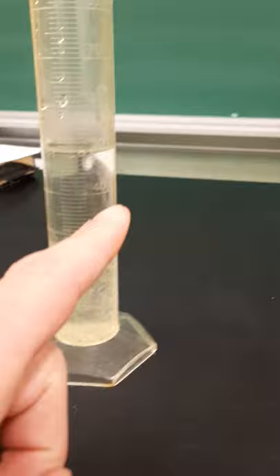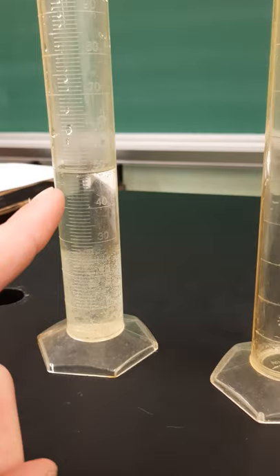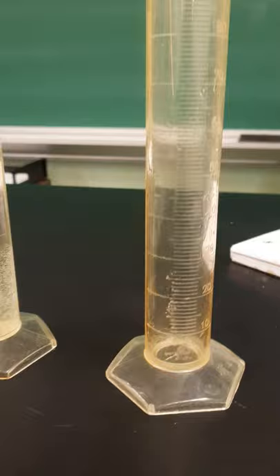I'm not going to repeat this experiment with alcohol because the exact same thing happens: 25 milliliters of alcohol plus 25 milliliters of ethanol yields 50 milliliters of ethanol.